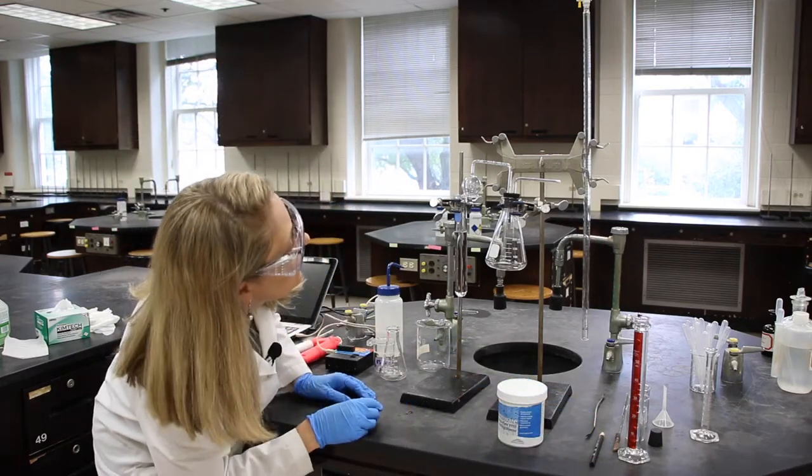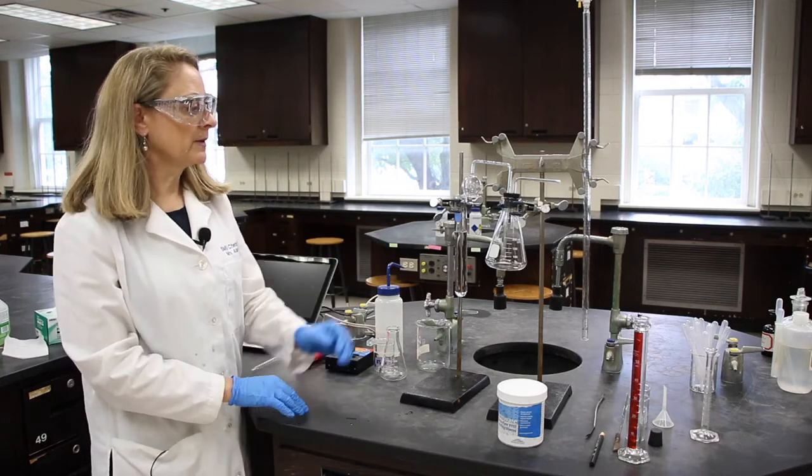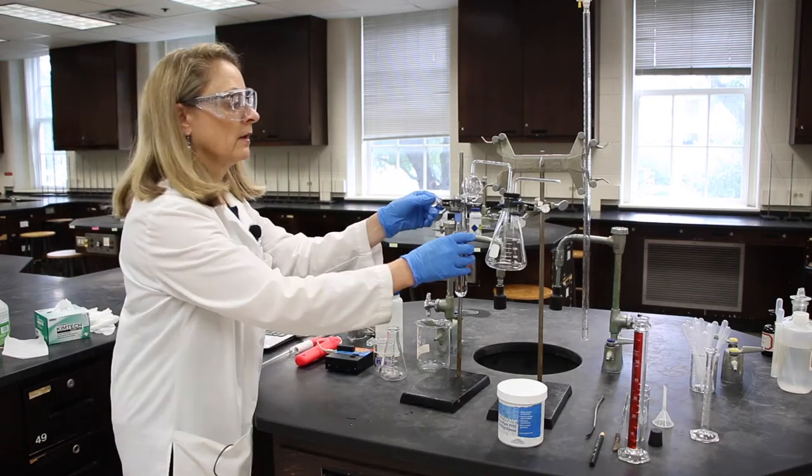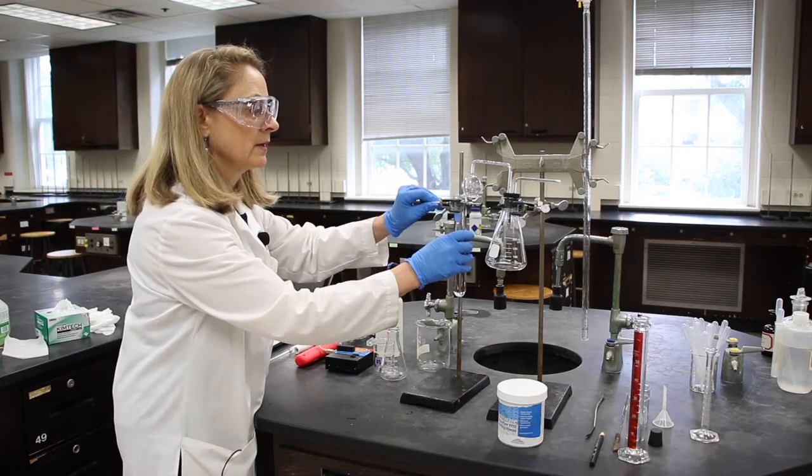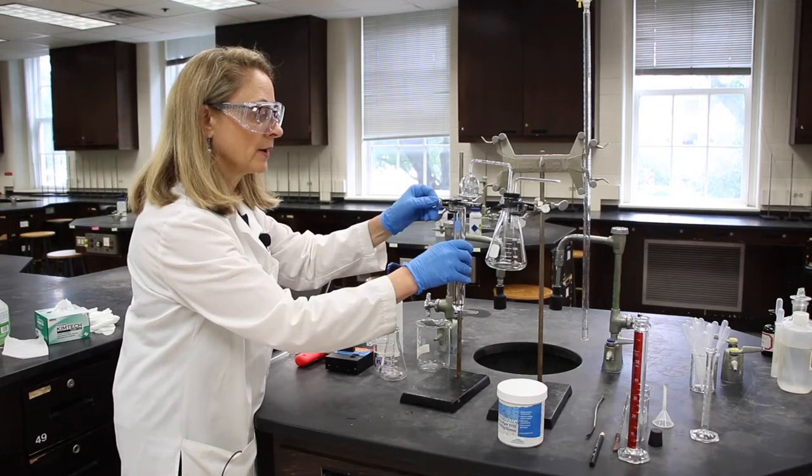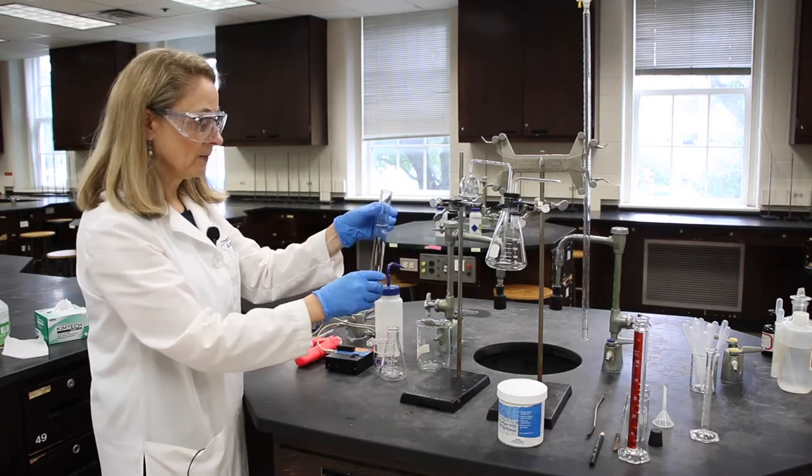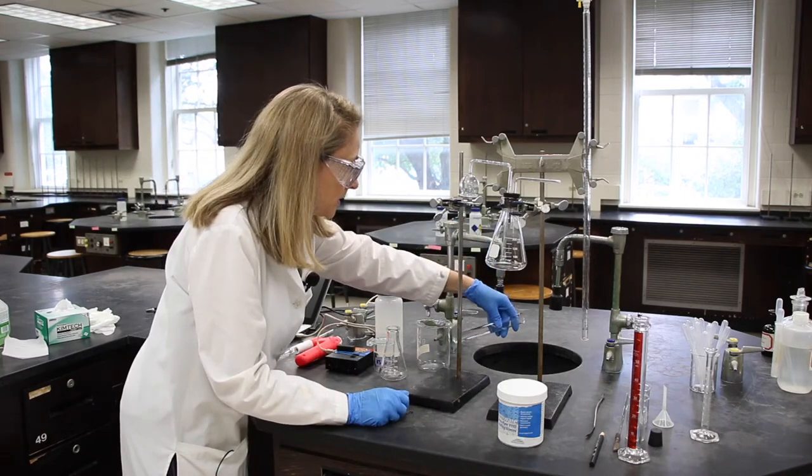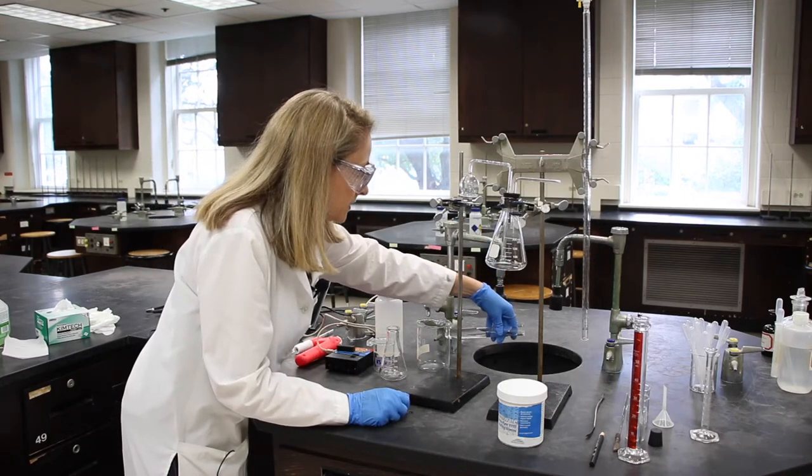And sometimes you can also mark it with tape, but this works fine. And then we will pour out the water. And this is step two now. And leave the boiling chips in the test tube.